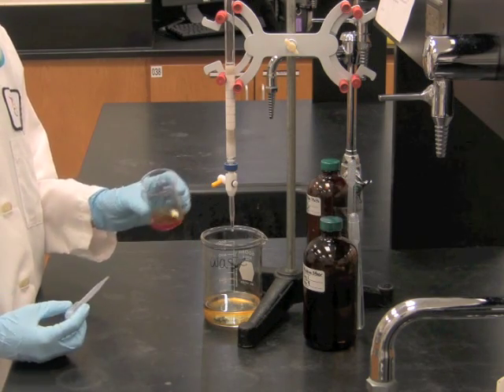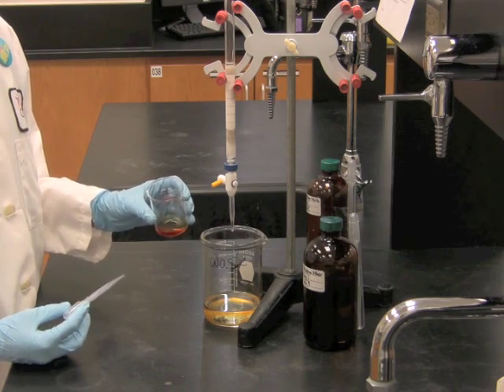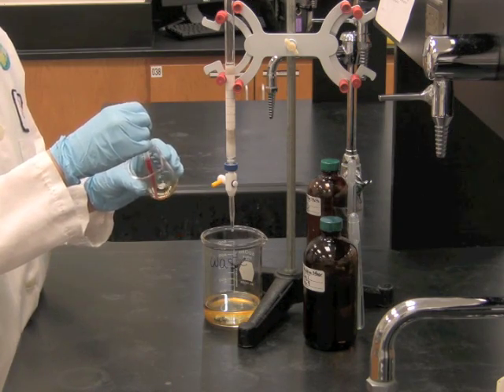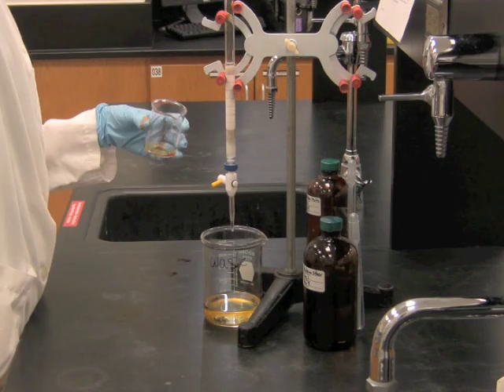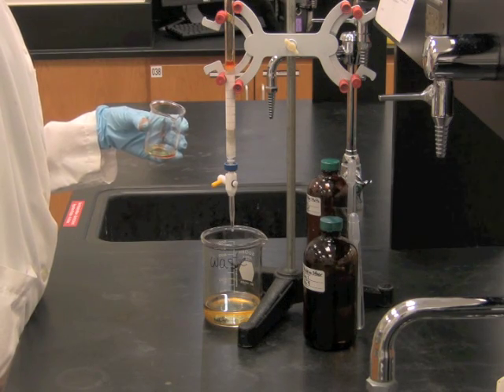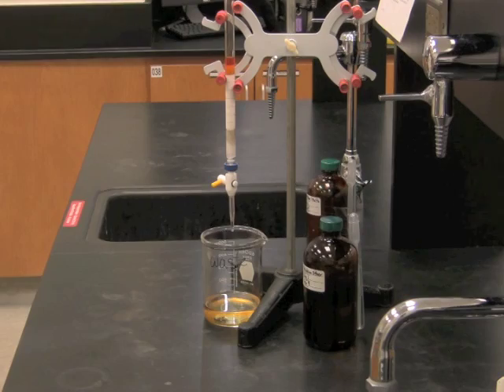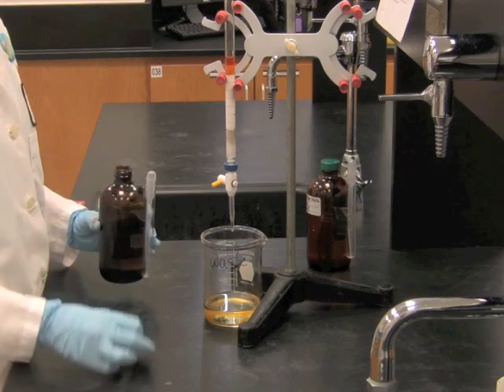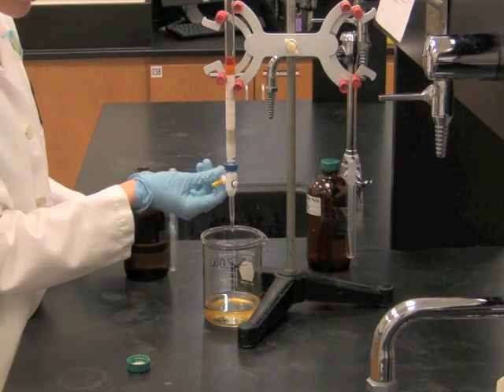Next, we're going to add our small sample to the top of the column with a different pipette. Once your sample is on the column, drain the solution to the top of the sand.